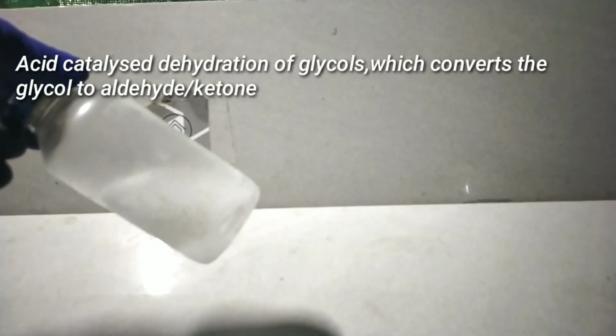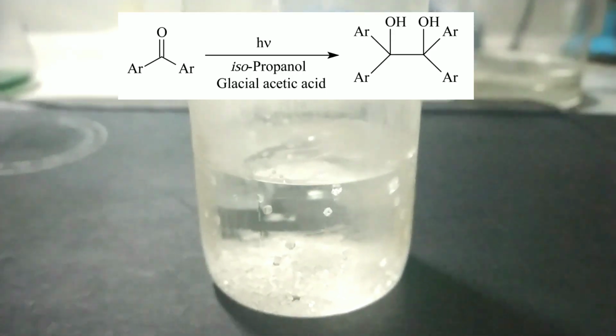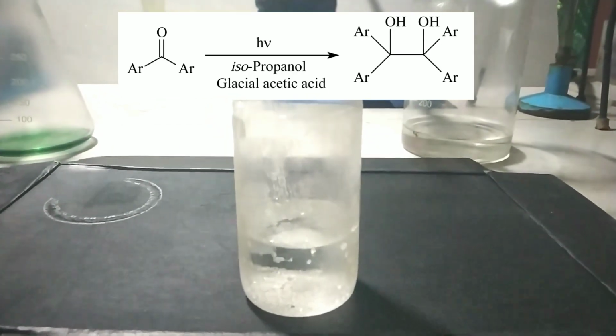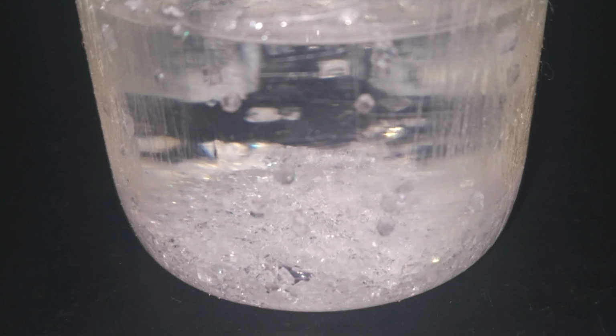After that, we keep the bottle in sunlight for 3 to 4 days. After 3 to 4 days, we observe some crystals forming in the bottle. Let it stand in sunlight for another day in order to ensure complete crystallization. What is happening here is a photochemical reaction, that is the reductive coupling of 2 molecules of benzophenone.